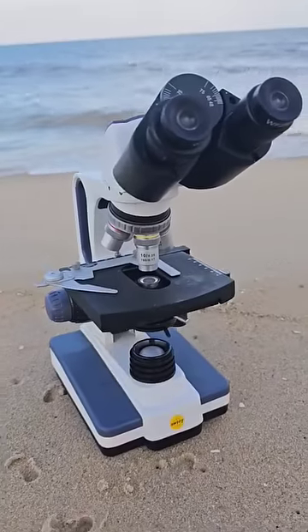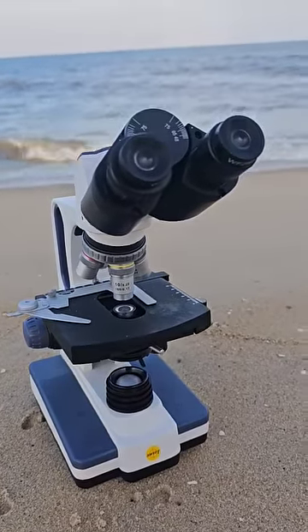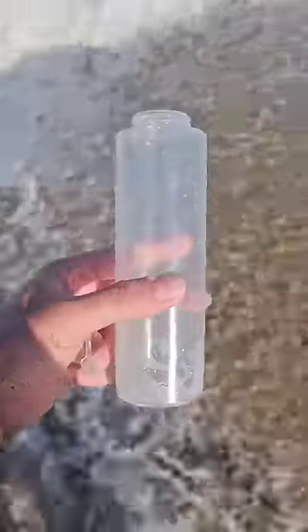We're going to take a look at ocean water under a microscope, just so you can see what kind of creatures you're swallowing when you're choking on seawater at the beach. I was always curious to know, so maybe you were too.